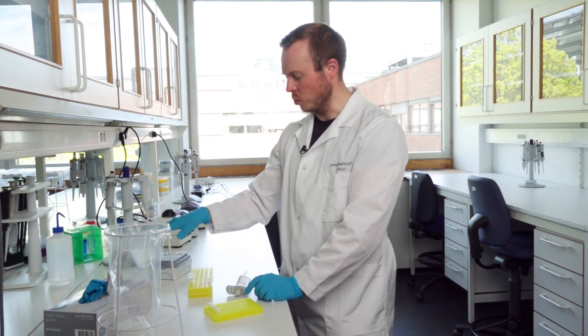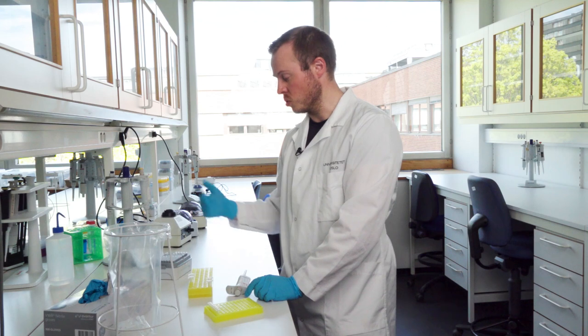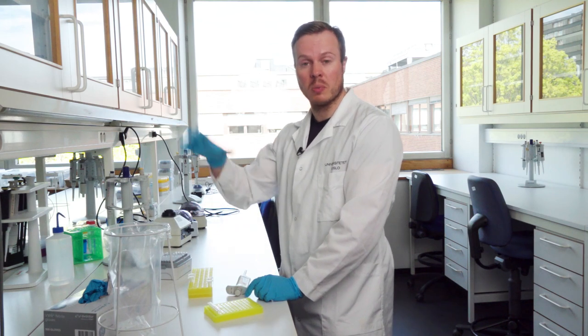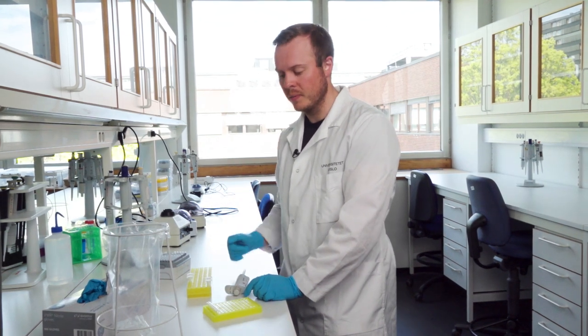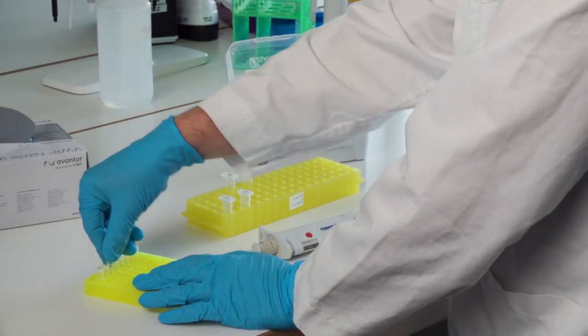And I move it down. You can also use the pipette box as a map, because you cannot take the pipette box from the pre-PCR here either, but take a new box and use it as a map in the same way if you need.